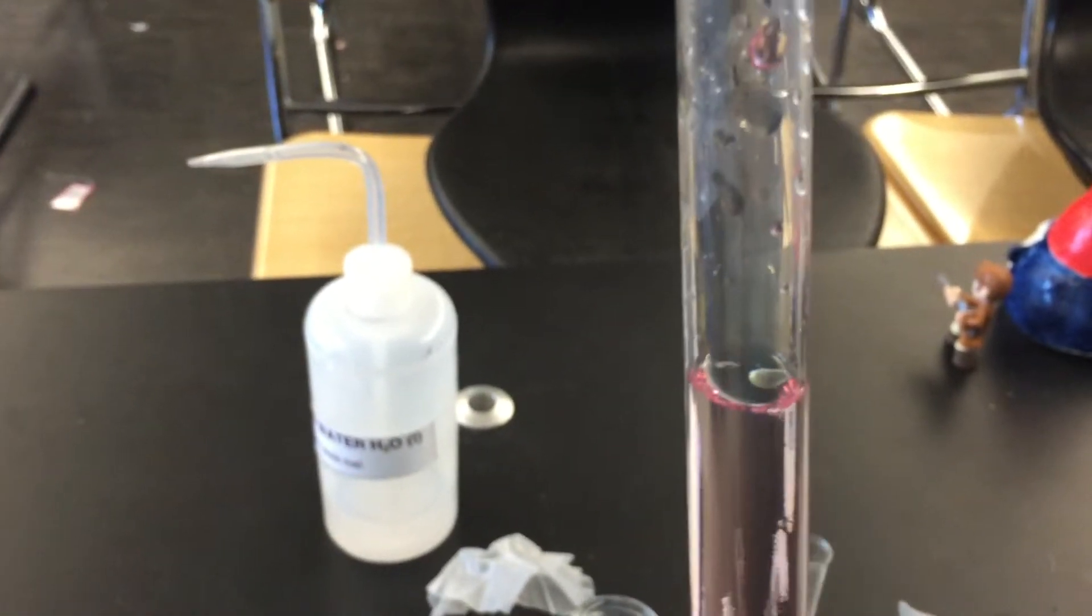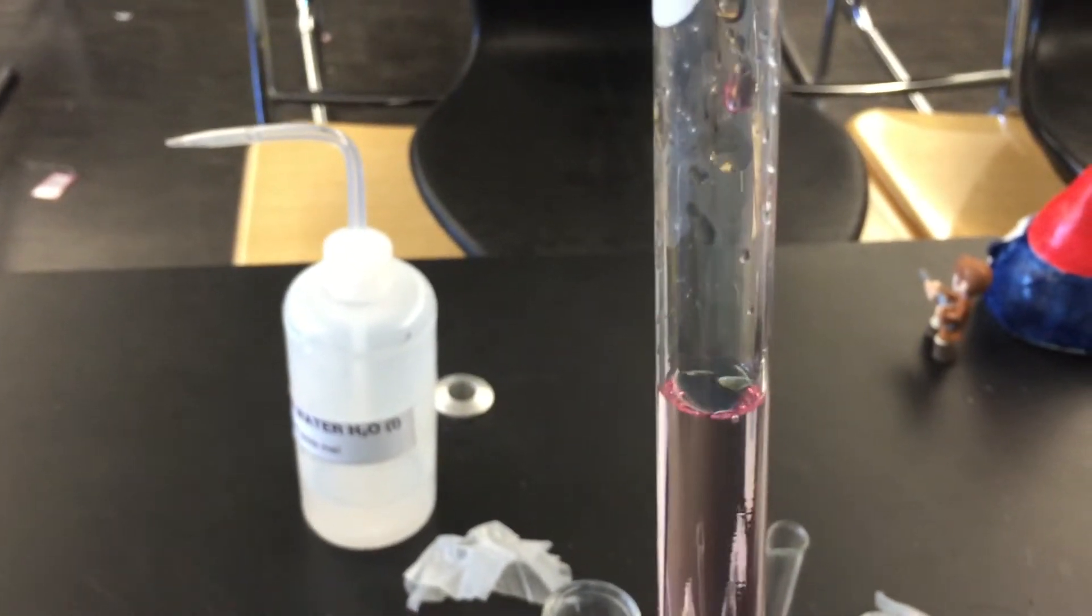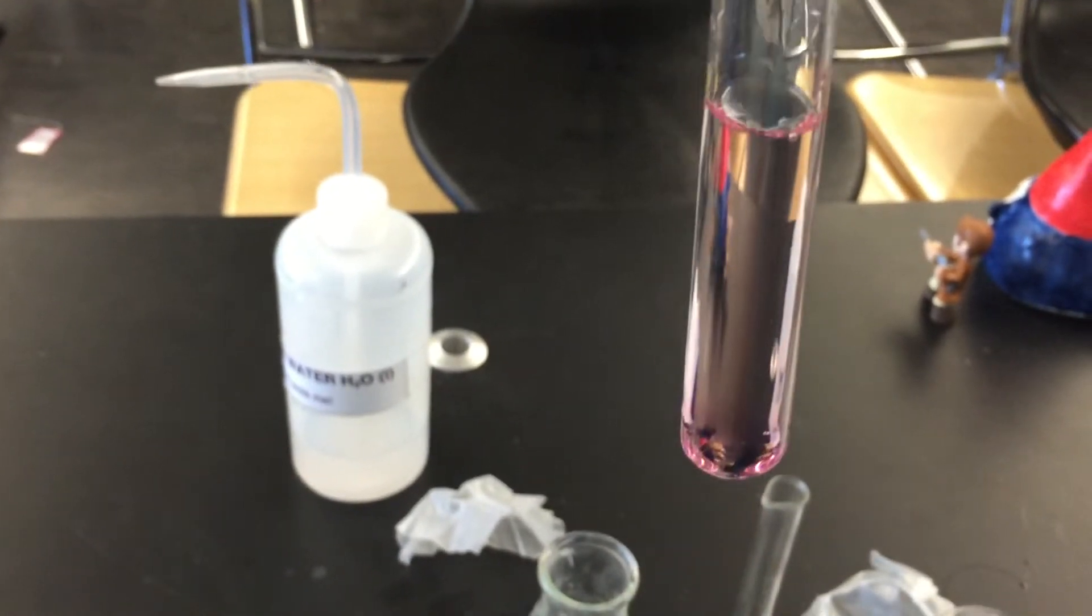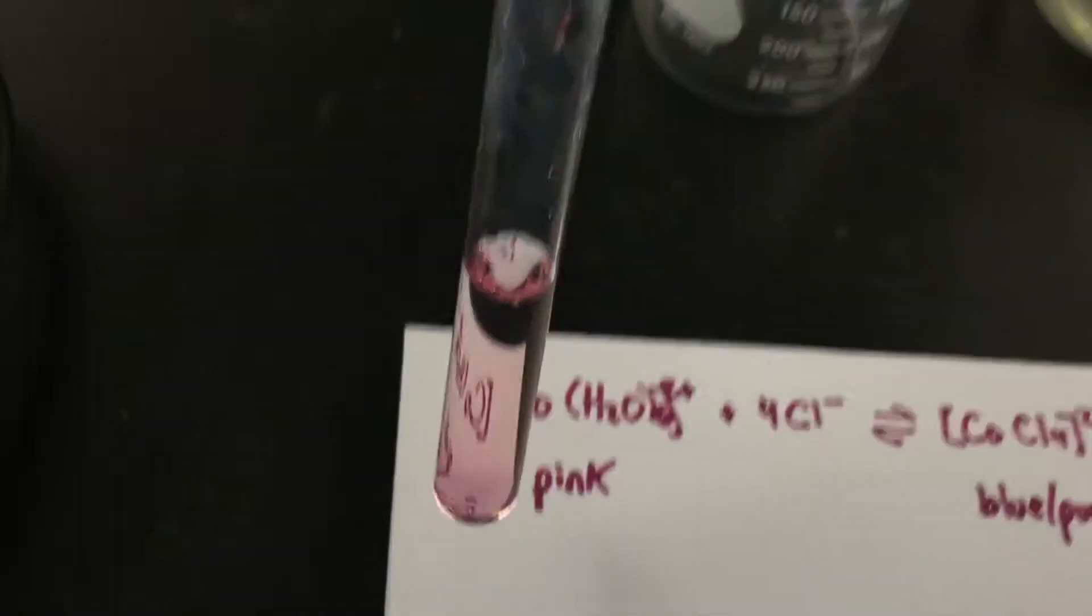It's not going to be the same dark pink color, but you can see, especially where it's been, we now have a pink colored complex again. It's still a little bit purple down here, but it looks like it's spreading out.